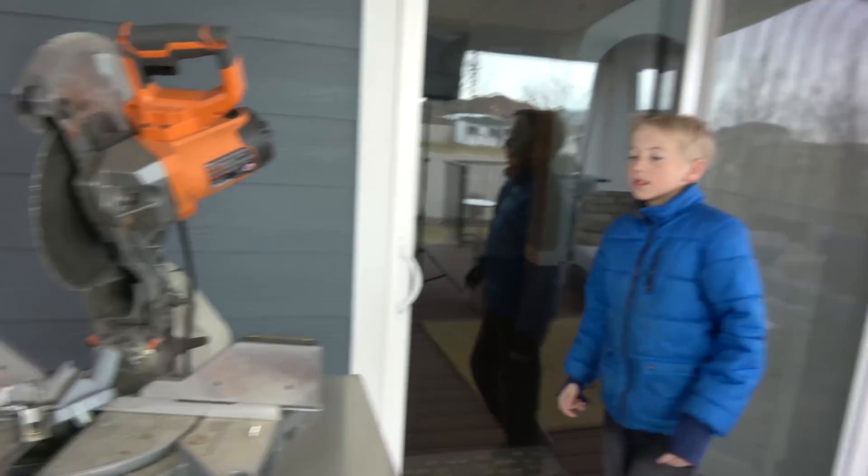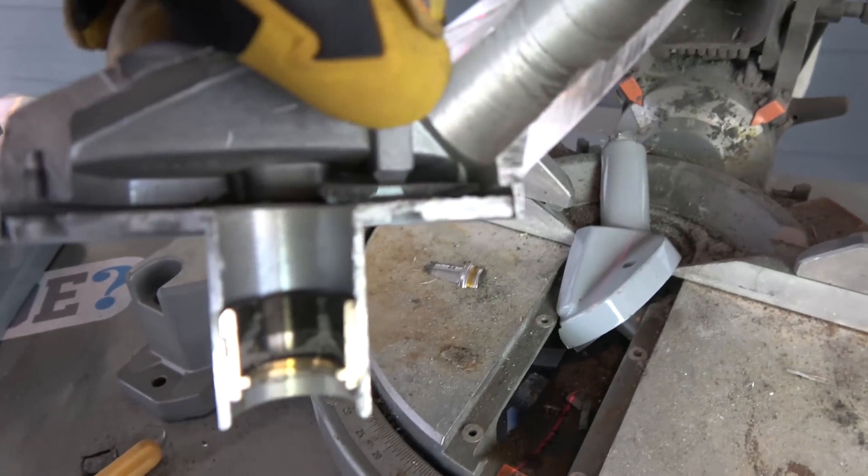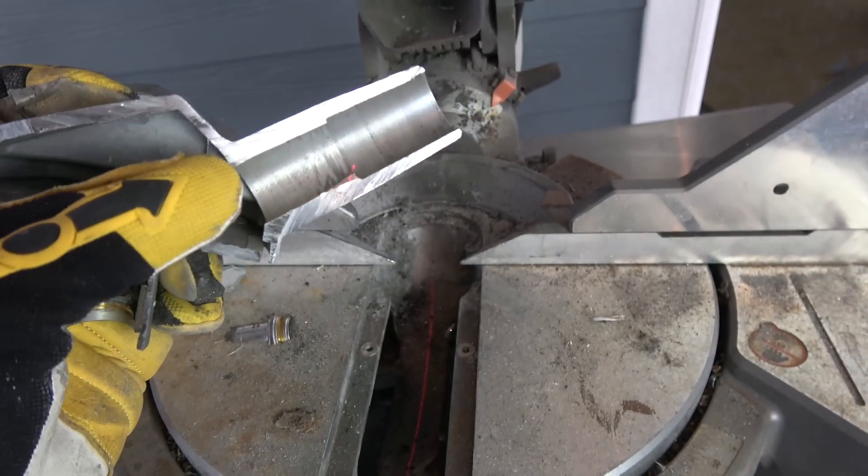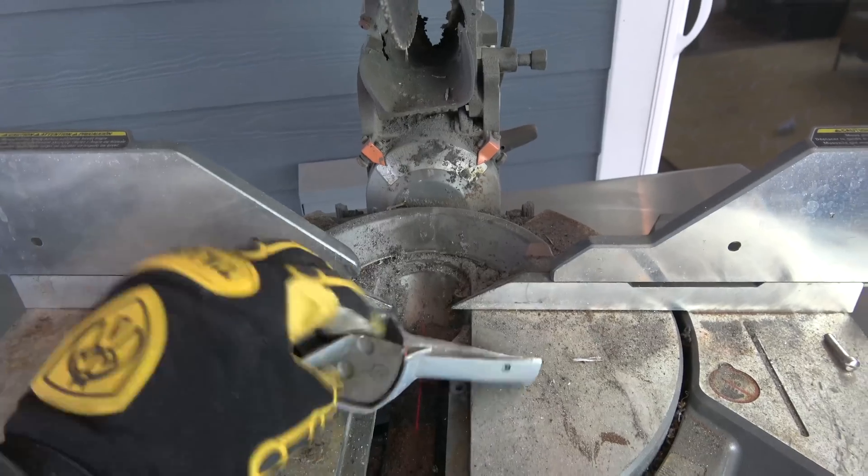All right, we got her. Where's those lenses? There's some glass in there. A mirror, I should say, that made the image so it would come up and turn and go up so you could see it up in there. All right, that's the top part.